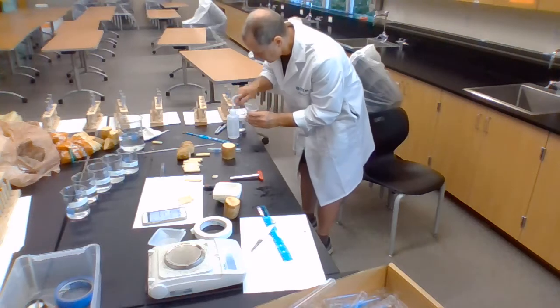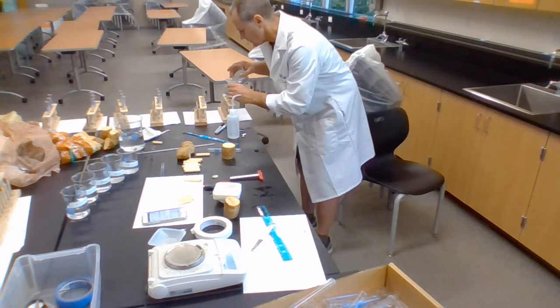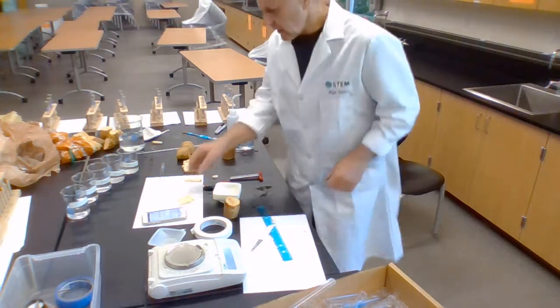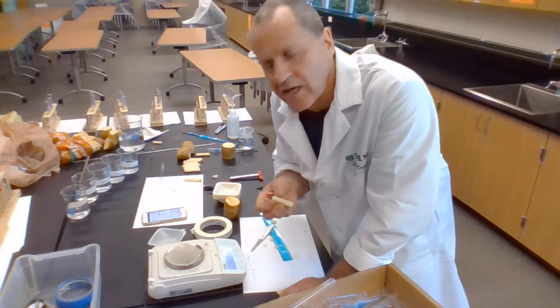And that one's a bit too much. You notice I'm not being all that careful about the volume. As long as they're covered with this stuff, that's fine. And then I plop them in. But obviously before I do that, I need to measure my masses.